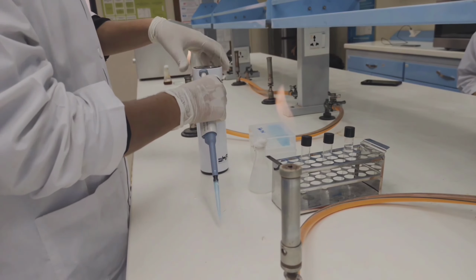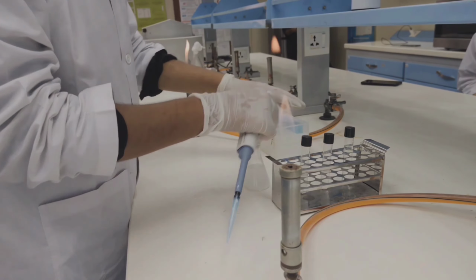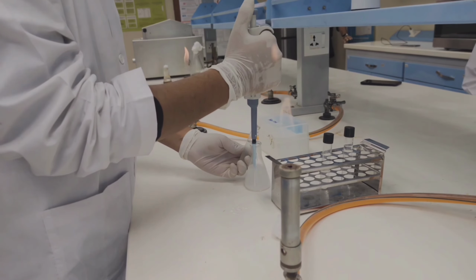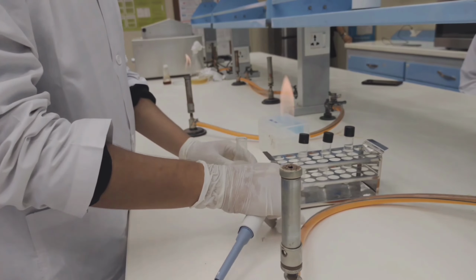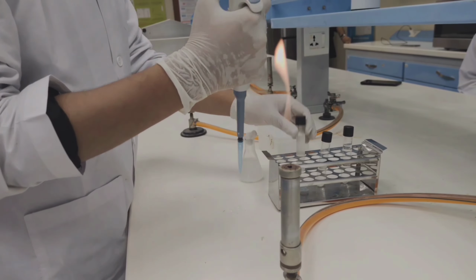Then we have to shake it to mix the solution well, and then we have to inoculate sample from that flask, from the diluted flask, to another test tube in which only diluent is present. Then we have to take 1 ml sample and inoculate in the other test tube. Now we have to shake that test tube to get the solution mixed well and seal all bottles to avoid contamination.